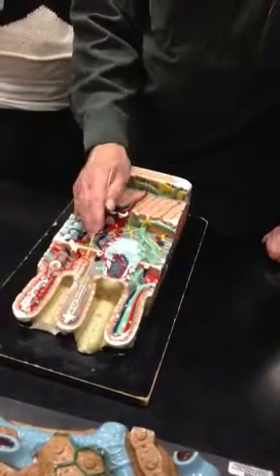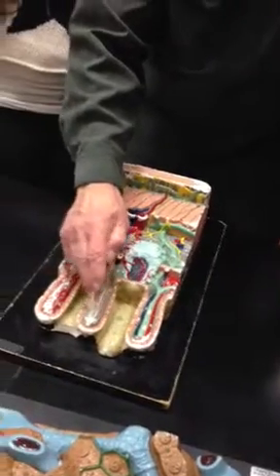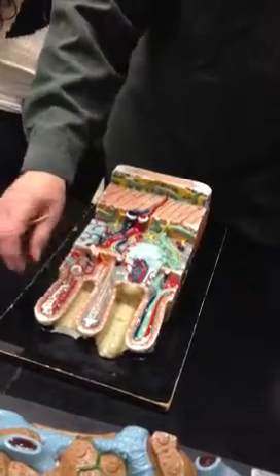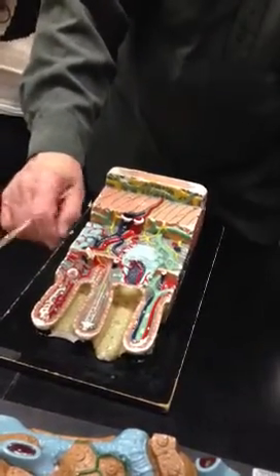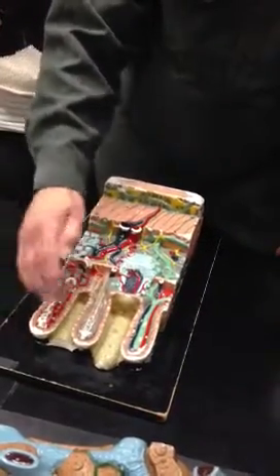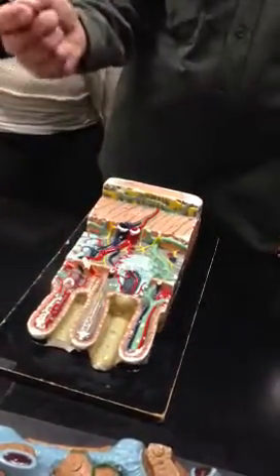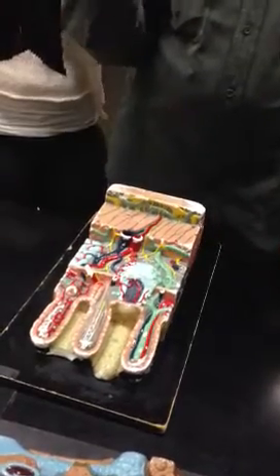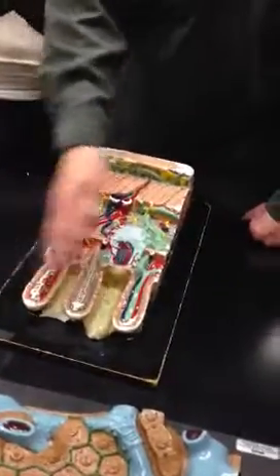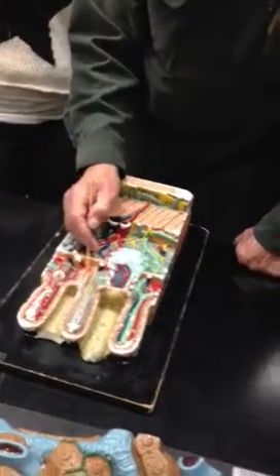One interesting thing about this area is that these epithelial cells are subject to a lot of wear and tear from digestive juices, from pieces of nut and other hard debris that comes down the pike that we've eaten. So they break up, they fall apart, and they get thrown into the digestive mix here. So to a small extent, we're sort of auto-cannibalistic. You know, we digest our own cells, and they also empty their enzyme contents in to contribute to the digestive process.